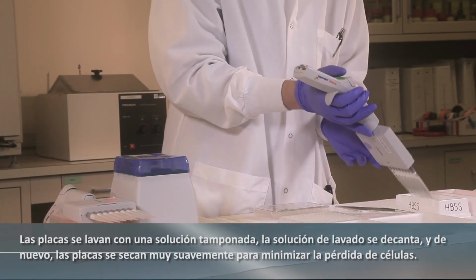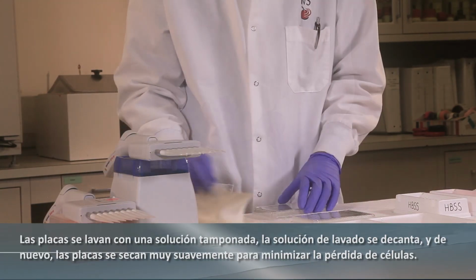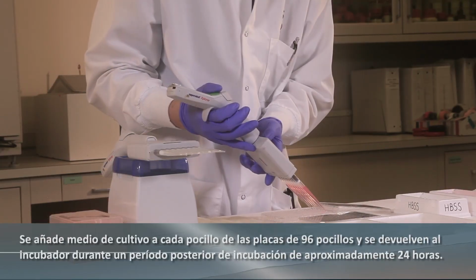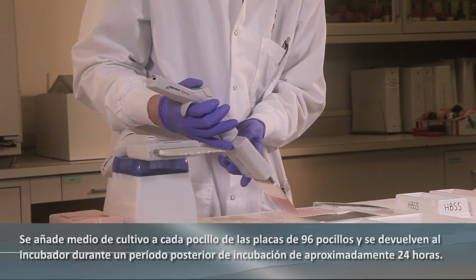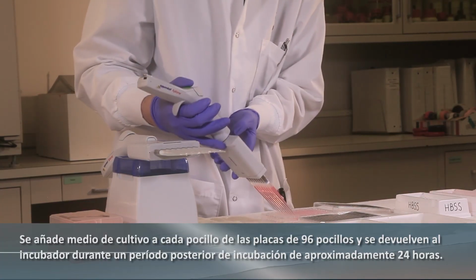Plates are rinsed with a buffered solution. The rinsing solution is decanted, and again the plates are blotted very gently to minimize cell loss. Culture medium is added to each well of the 96 well plates, and the plates are returned to the incubator for a post-incubation period of approximately 24 hours.